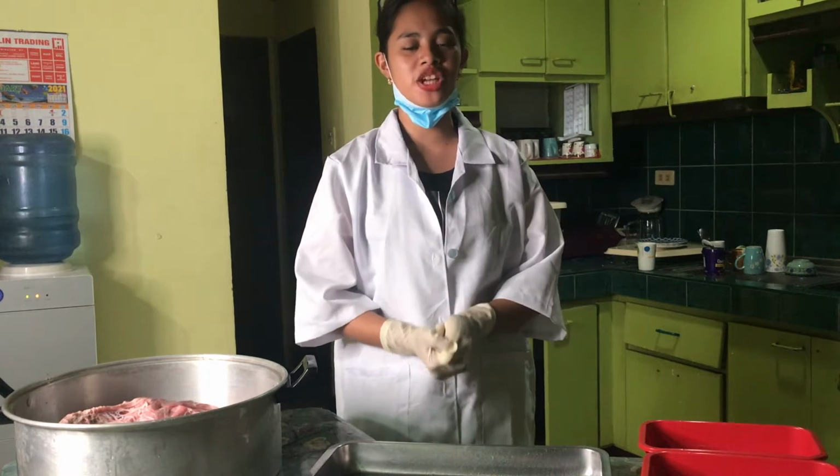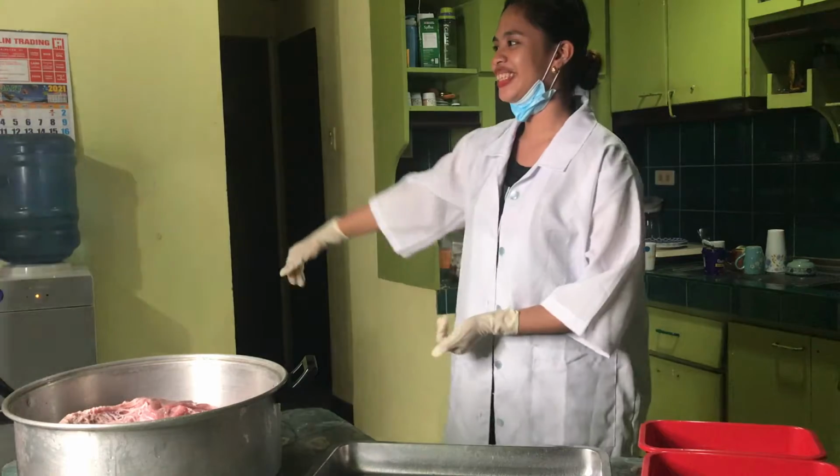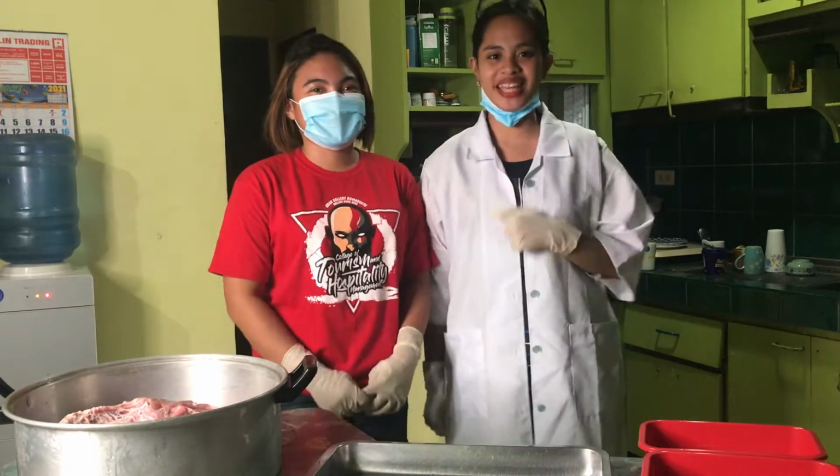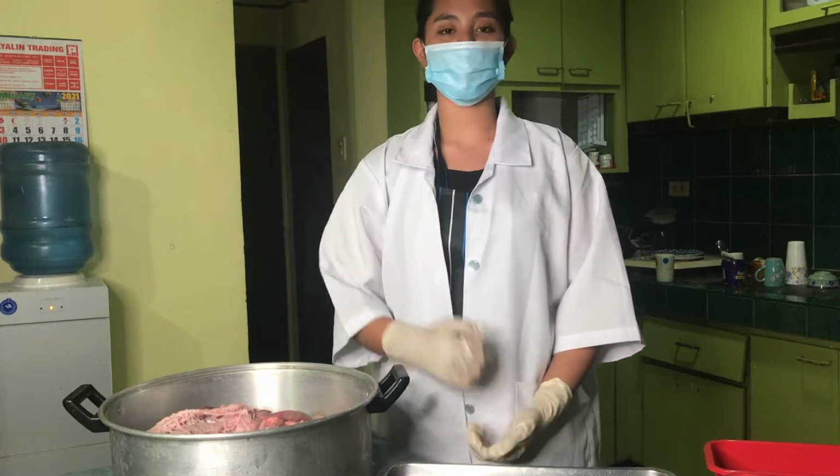Examine the pig digestive tract. And I want to introduce my assistant for today, Ivan Anino. So let's begin. Our first thing to do is to dissect the stomach.